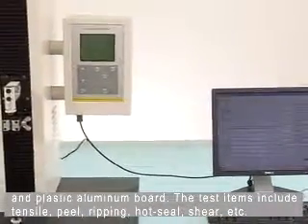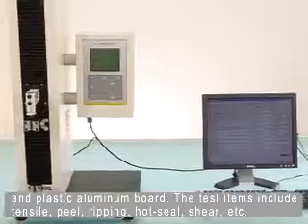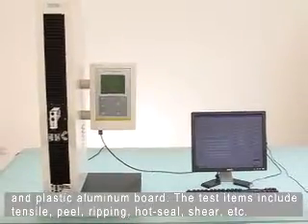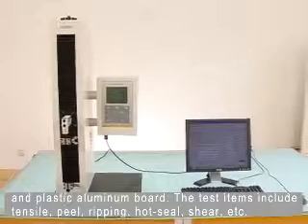The test items include tensile, peel, ripping, hot seal, shear, etc.